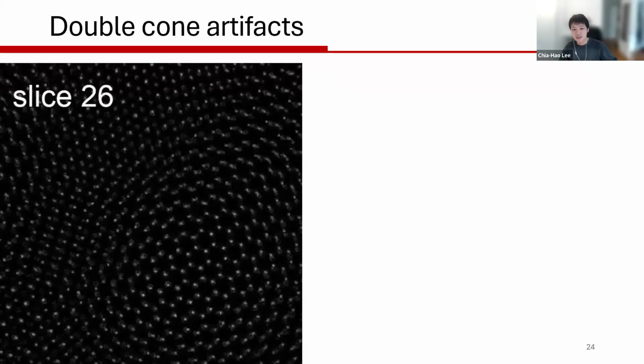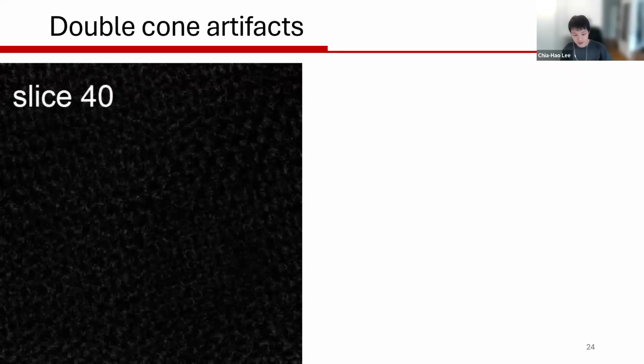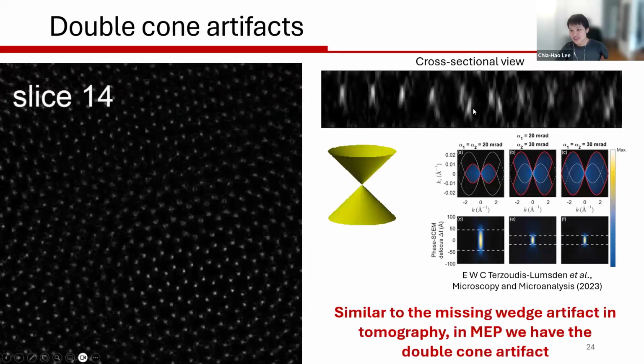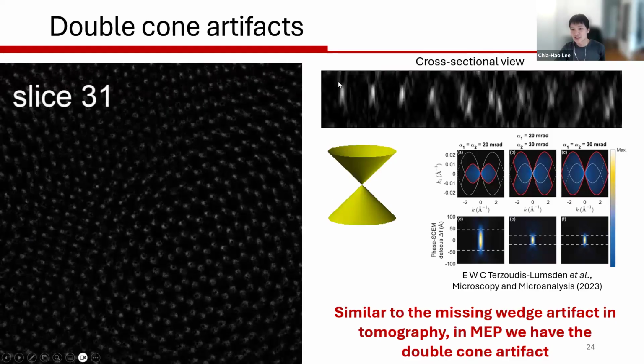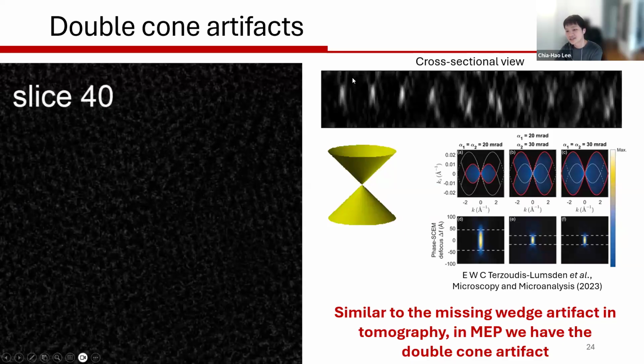Yeah, so it looks almost like the 3D point spread function of a coherent imaging technique. And I'm sure I'm not the first one to see these. If you just take a cross section of this reconstructed object, you actually see these. If you do a line profile here and take a cross section, it actually looks like an X shape. Kind of looks like the DNA shape. So you have an X here, and geometrically it feels like a double cone.